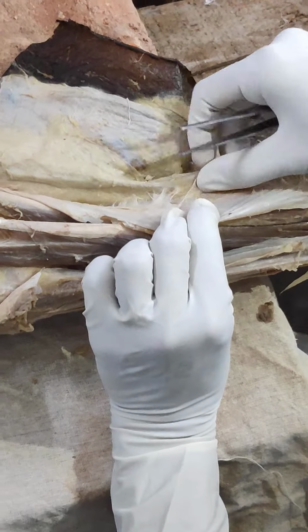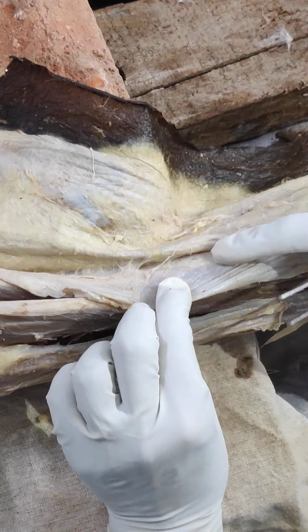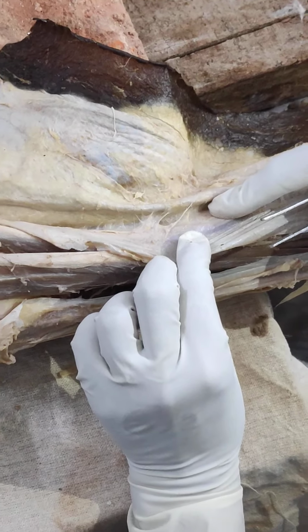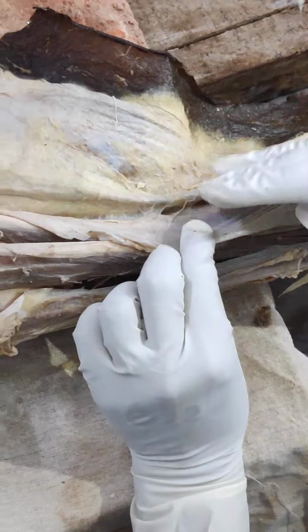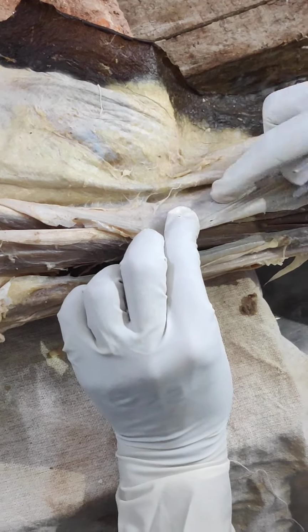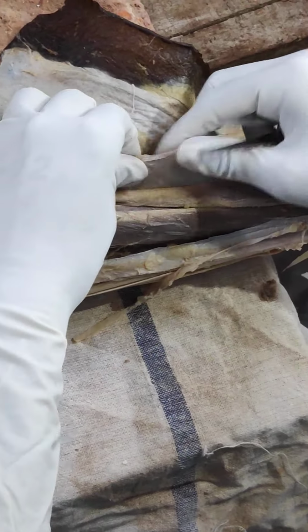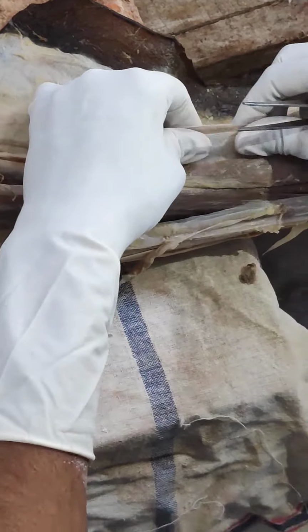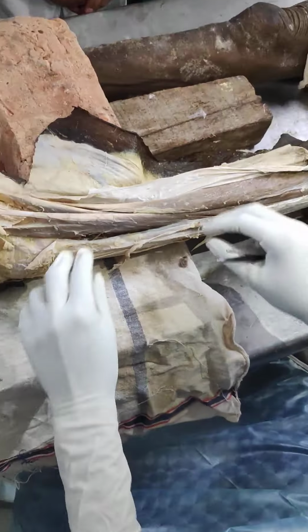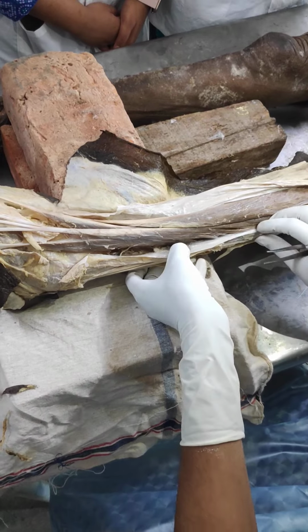The deep fascia is very tightly adhered to the anterior border and medial surface of the tibia. Check it from the books. On the medial surface of the tibia, the deep fascia is tightly adhered. So it is closely adhered, and from the anterior border I cannot separate the deep fascia. Now, like that, I did the dissection and came downwards.